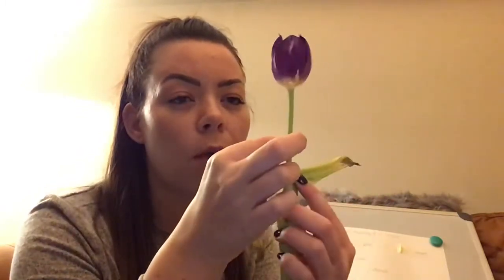And then underneath that in the flower, I'm not going to be able to cut this bit out, but that's where the juicy nectar is that the bees like to take. Now there's another part of the flower that's not actually on this tulip. It's got big leaves here, this tulip, and obviously it's got this stem that holds up the flower on top. But some flowers have some little leaves at the bottom here, especially roses, and they're not actually little leaves, they're called the sepals. But this one doesn't have it, unfortunately. It's just got leaves here.